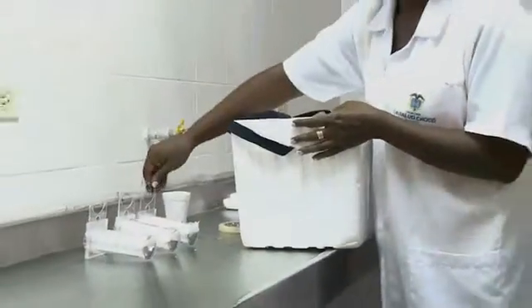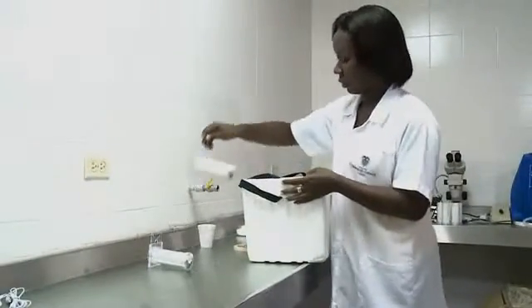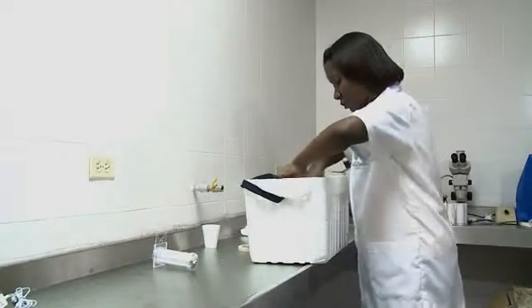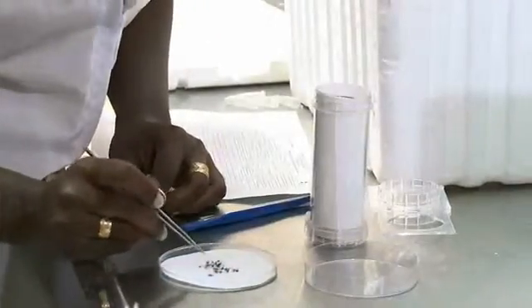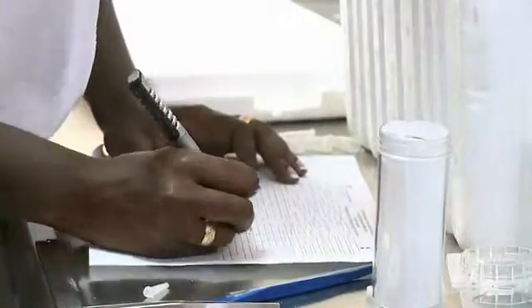Under field conditions, the tubes with the mosquitoes should be covered with moist towels and kept for 24 hours in insulated coolers. Make sure to use different coolers to store the resting tubes for the controls and the resting tubes for the exposed mosquitoes. After 24 hours, count the number of mosquitoes dead or alive, recording the data on the information sheet.